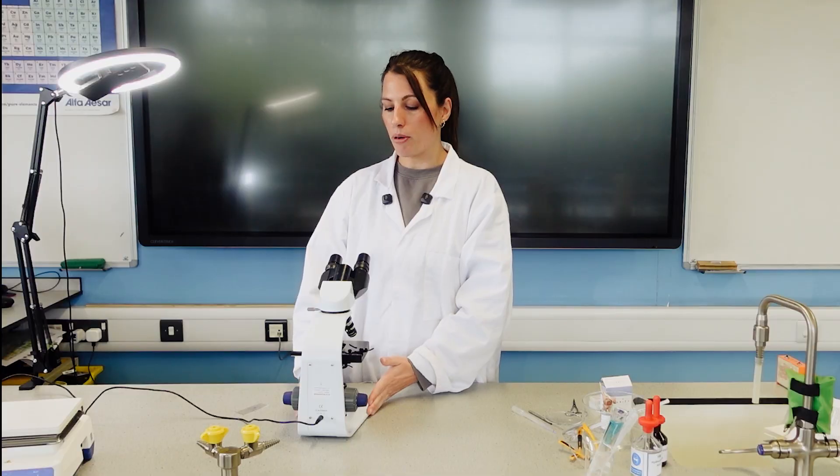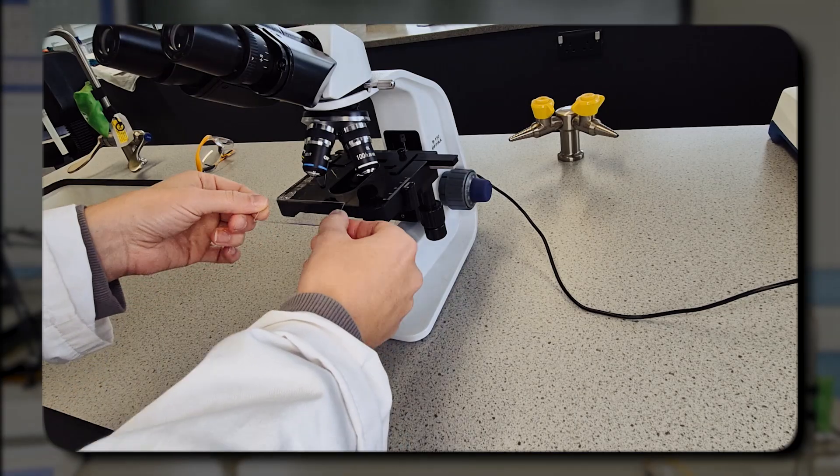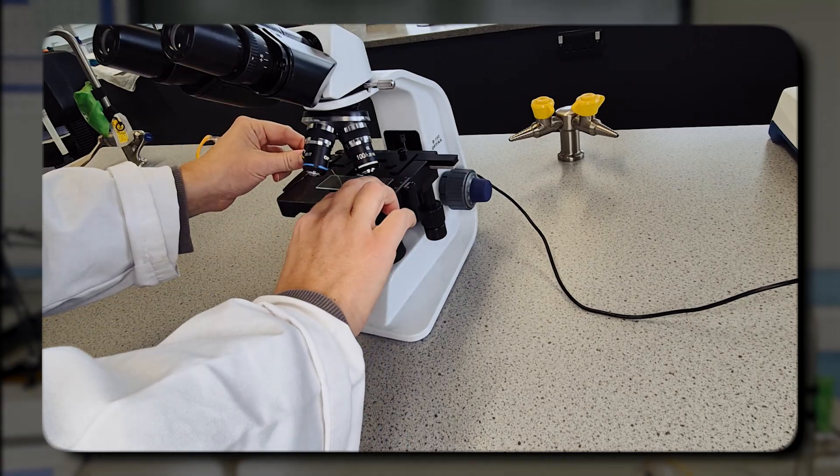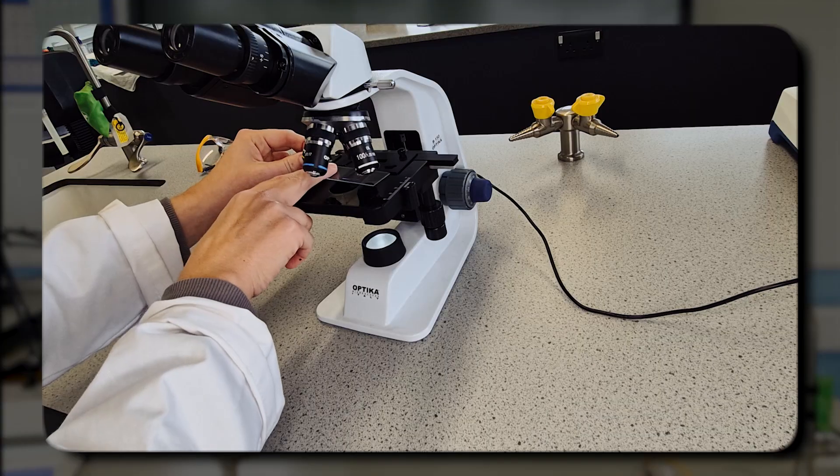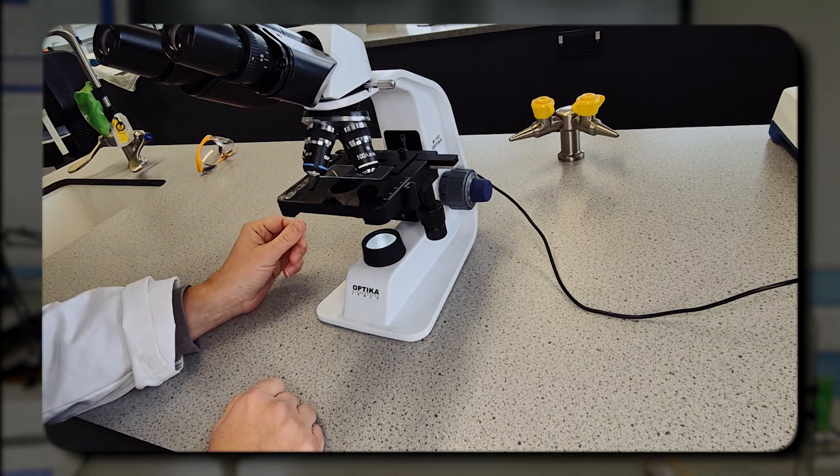So we now just have our slides. They can take off their goggles looking at the microscope. I'm going to take my microscope slide and get the students to place it on the stage, and it's then clipped into position.